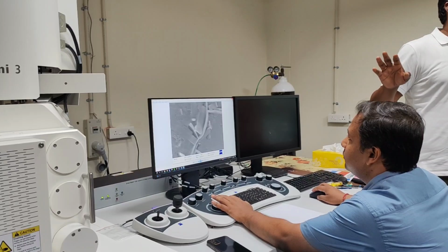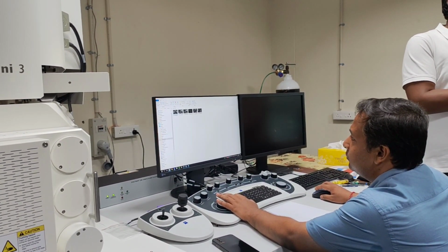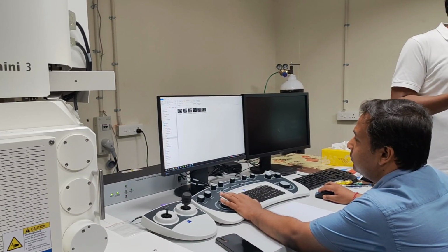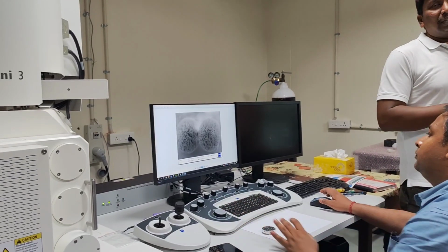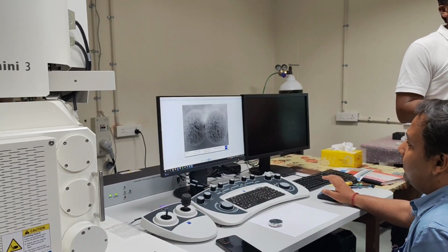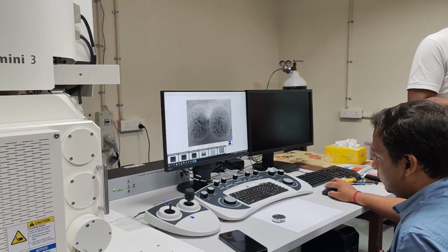All other metals, thin films, coatings, fracture analysis, or if you are working on a chemical route where you synthesize some materials, precipitates, these are all very easy, direct, and straightforward, and you can do them. The challenge will come only when you work with non-conducting samples, beam sensitive samples, biological samples, moisture containing samples.